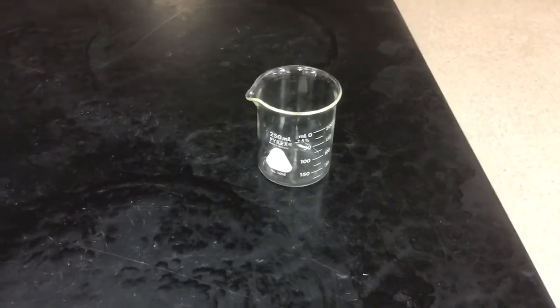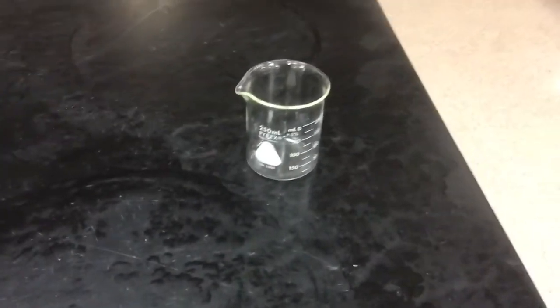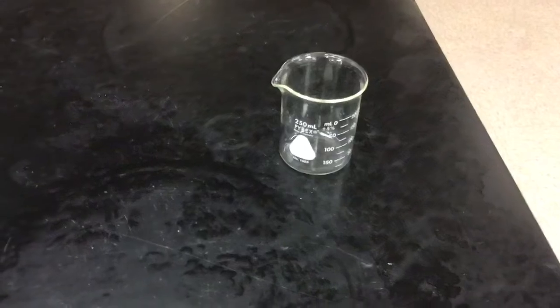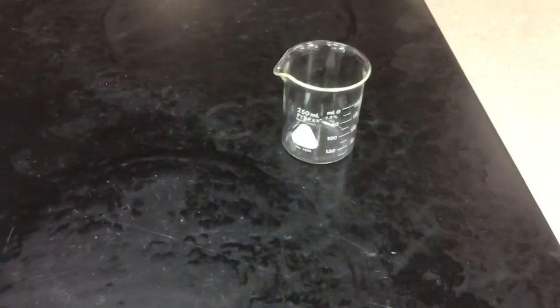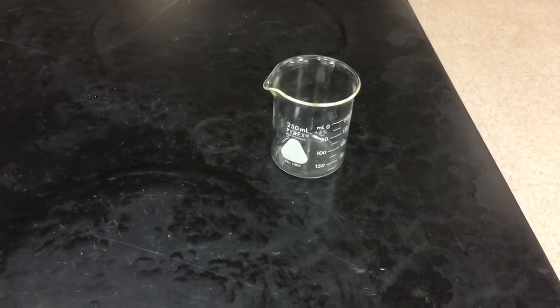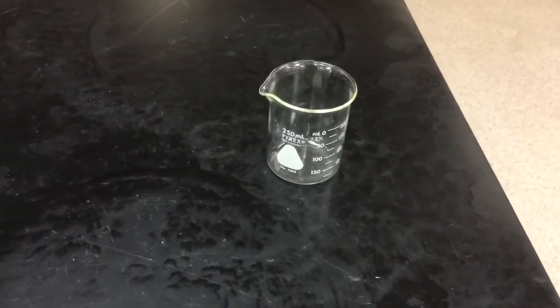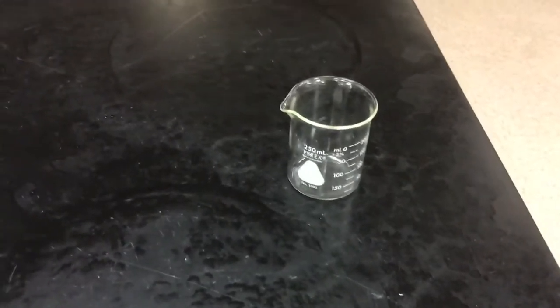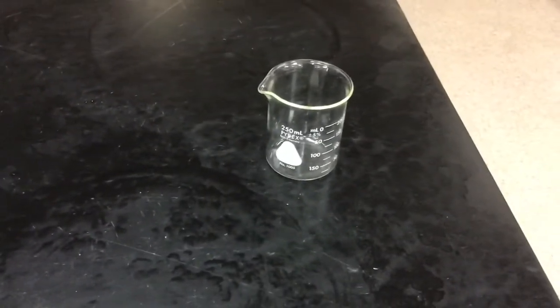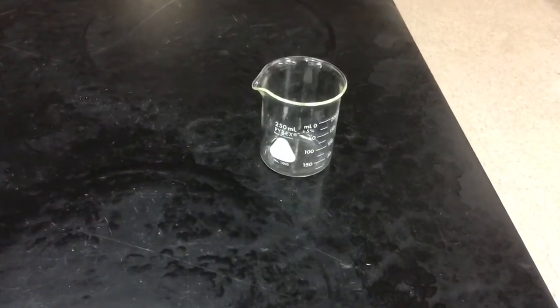And then the last one is biological oxygen demand, and all we do on that is we take a small vial and wrap it in tin foil, and we measure the dissolved oxygen before and after, and that tells us if there are any microorganisms using up oxygen. So that's it. So tune in tomorrow when we look at some of these results.